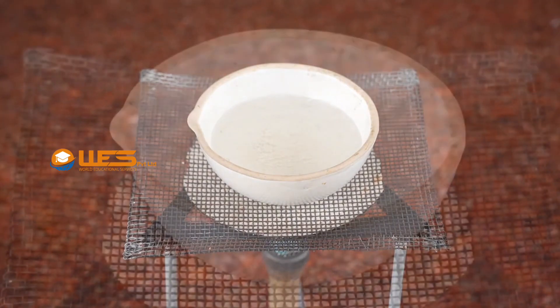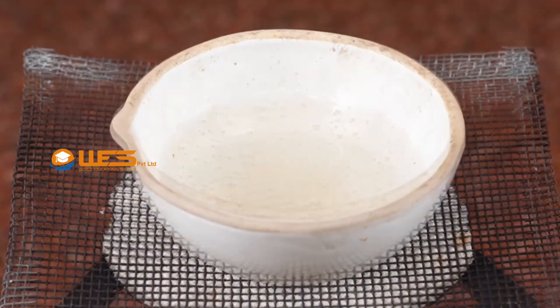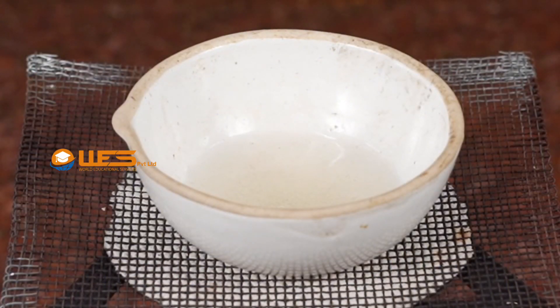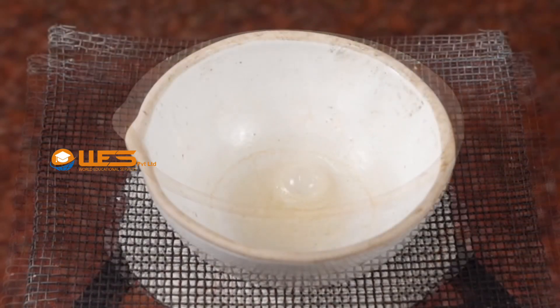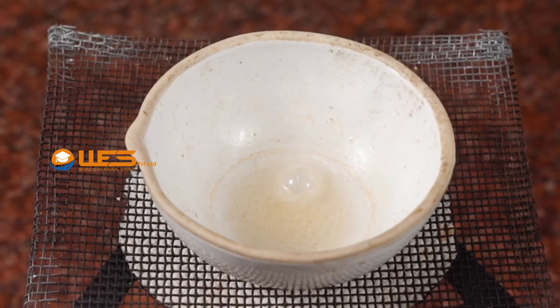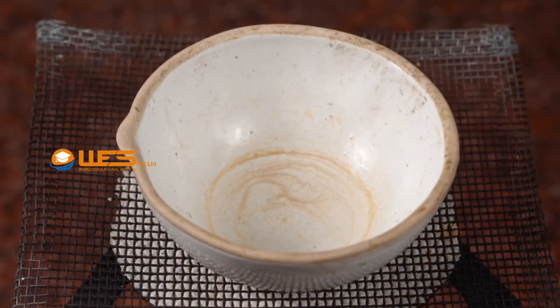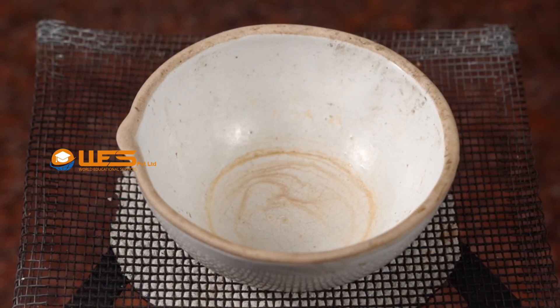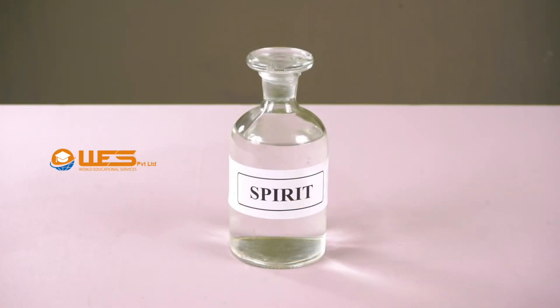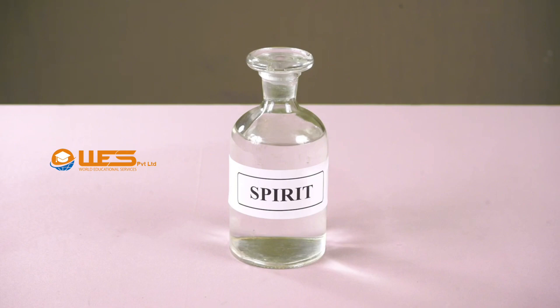Observe how the contents in the china dish disappear with time. Continue heating until all the water evaporates. Repeat the experiment taking spirit as a sample.